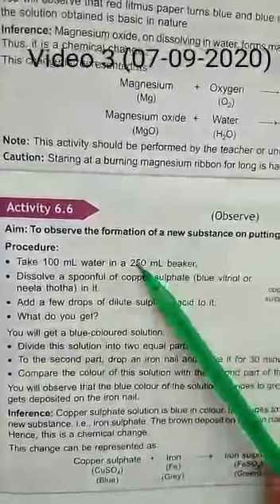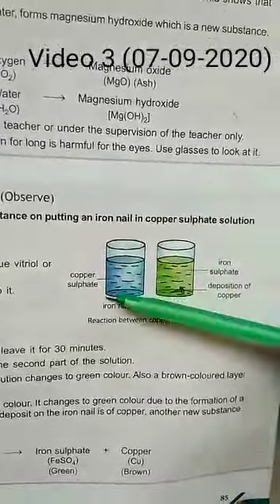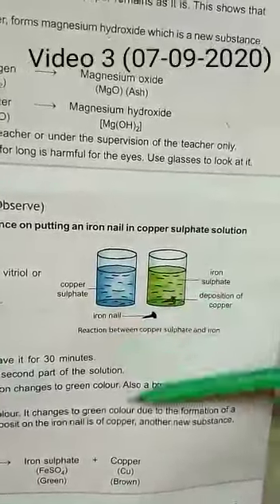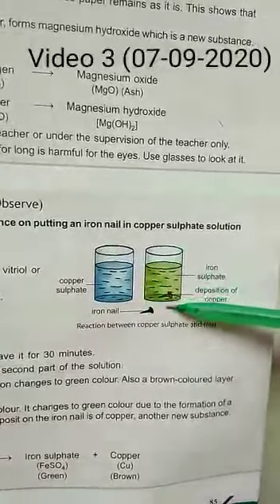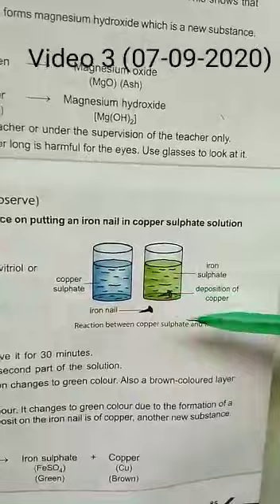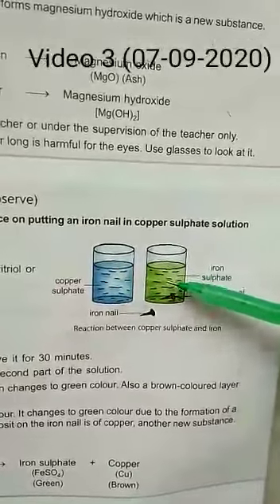Another activity: observe the formation of a new substance by putting an iron nail in copper sulfate solution. The copper sulfate solution is blue in color. When you put the iron nail into it, the color changes from blue to green, showing that iron has started depositing copper and changing the color of the solution.